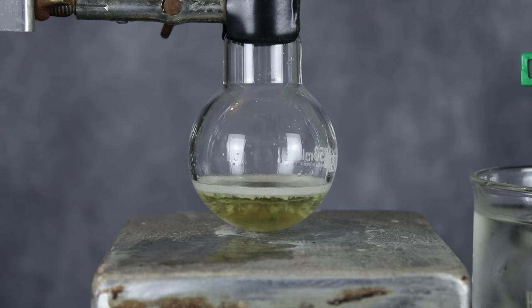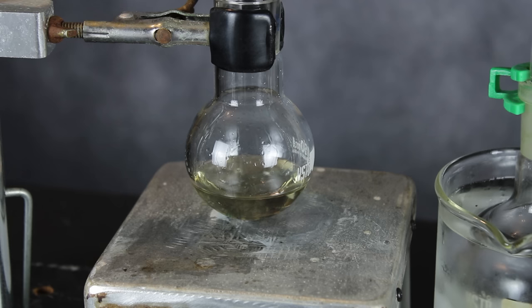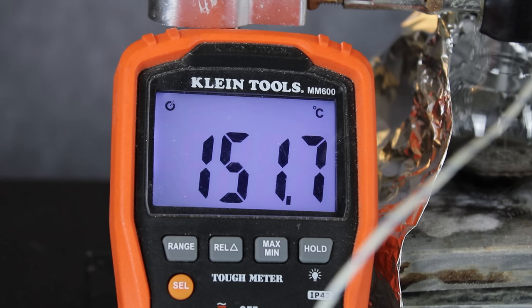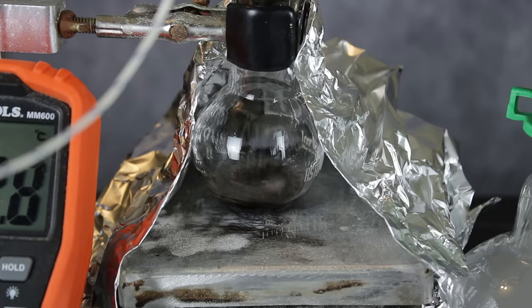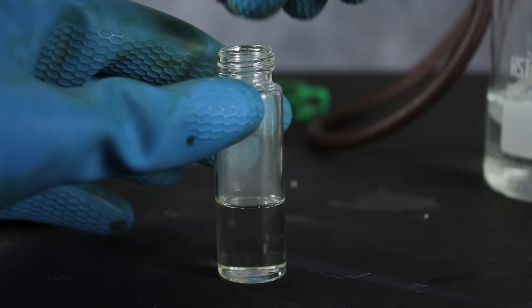Phosphoryl chloride is a liquid like chlorosulfonic acid, but it has a lower boiling point, so distillation is the best means of separating the two — best being a relatively mild term, since the process does involve boiling a highly corrosive super acid after all. So once the sulfuric acid was completely added, the temperature was cranked up and the phosphoryl chloride was allowed to distill over. Once the temperature hit 150 degrees Celsius, the first fraction was isolated, and I started collecting the relatively pure super acid. It took about an hour in total, but in the end I had roughly 5 milliliters of fuming chlorosulfonic acid.